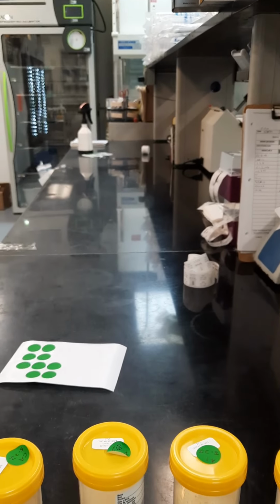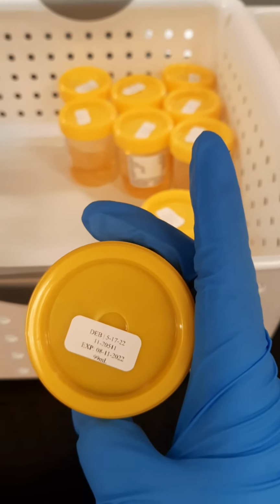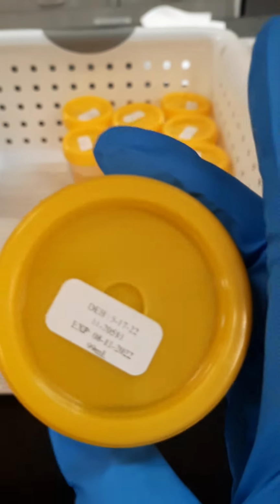You get to watch as I plate. I had already put these samples into these cups. As you can see, if we talk about dilutions, I'll do something easier. Here's a DE broth, 99 mils. So a 1 to 100 dilution would use these broths, in which case we'll put 1 mil in this 99 mil cup to make 1 to 100.